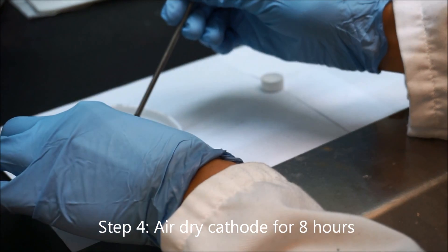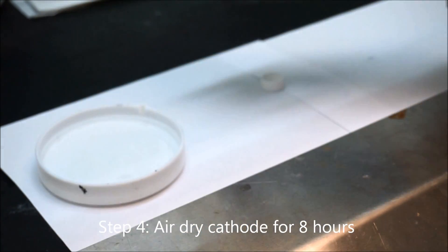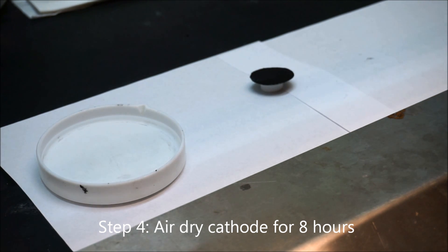Then we take out the cathodes and then leave the cathode in the fume hood and air dry for over 8 hours.